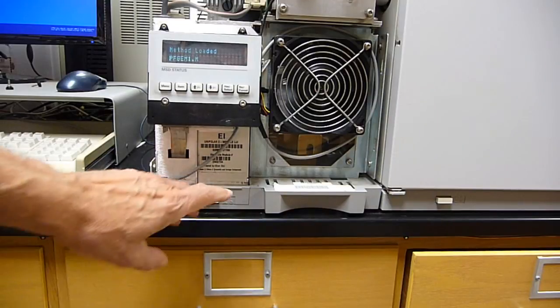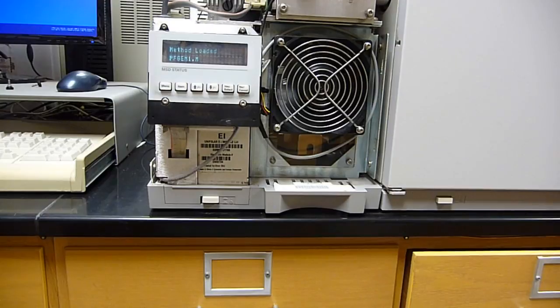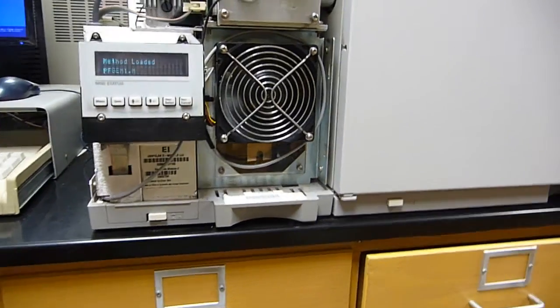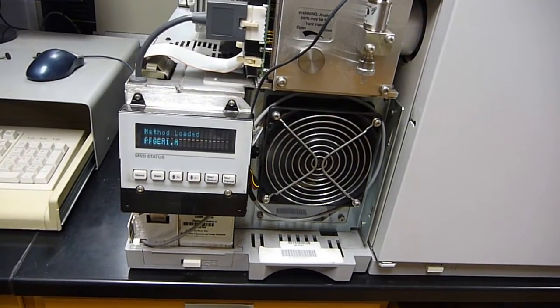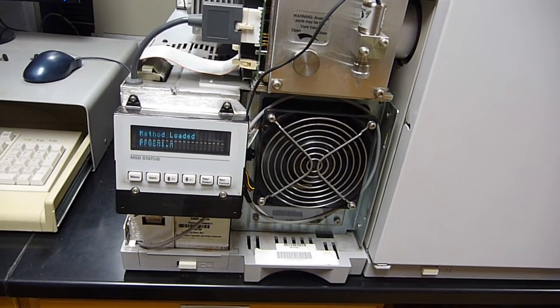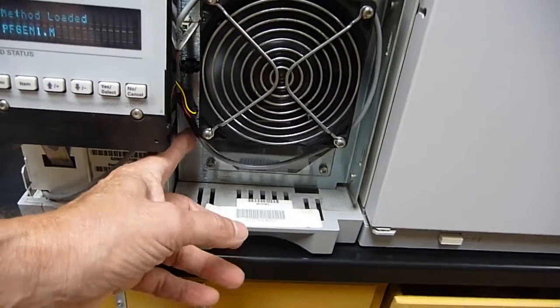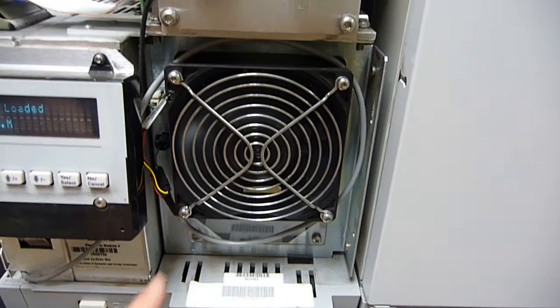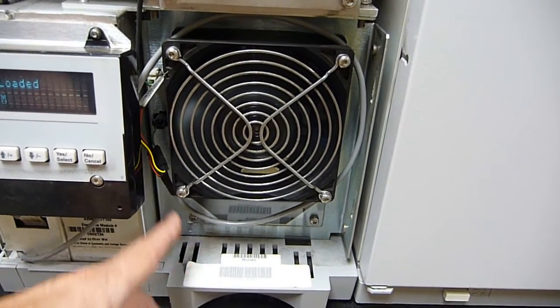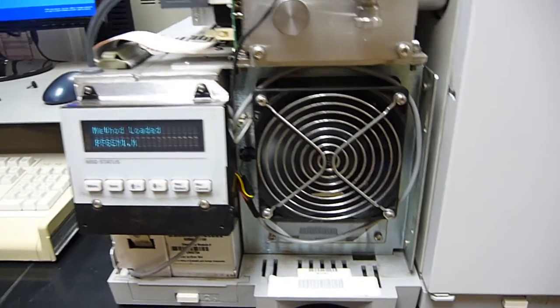And as an aside, in order to power this fan separately from the instrument control, it's not that difficult at all. What it requires is a UPS and then an AC adapter. All right? That's going to put out the appropriate voltage to here. And then you need some connectors because this one has an RPM signal. So if the RPMs drop below 90%, it's going to turn off the heater. So you want to get that information back to the instrument chassis.